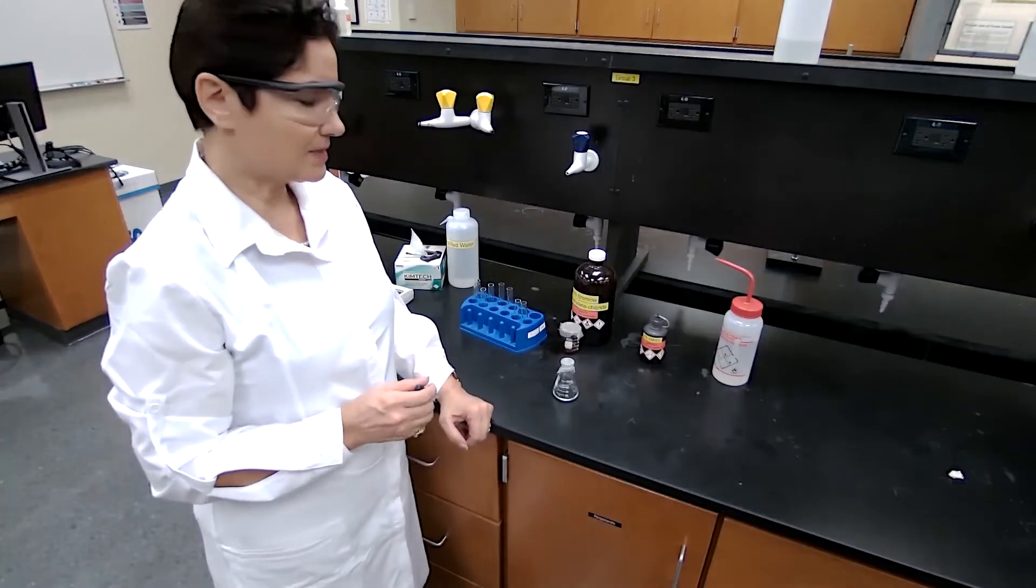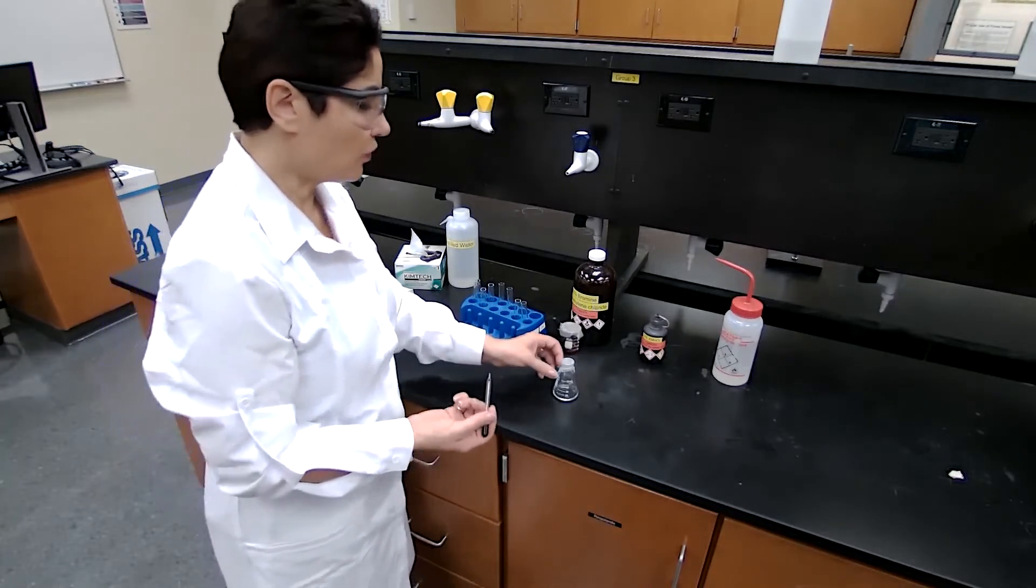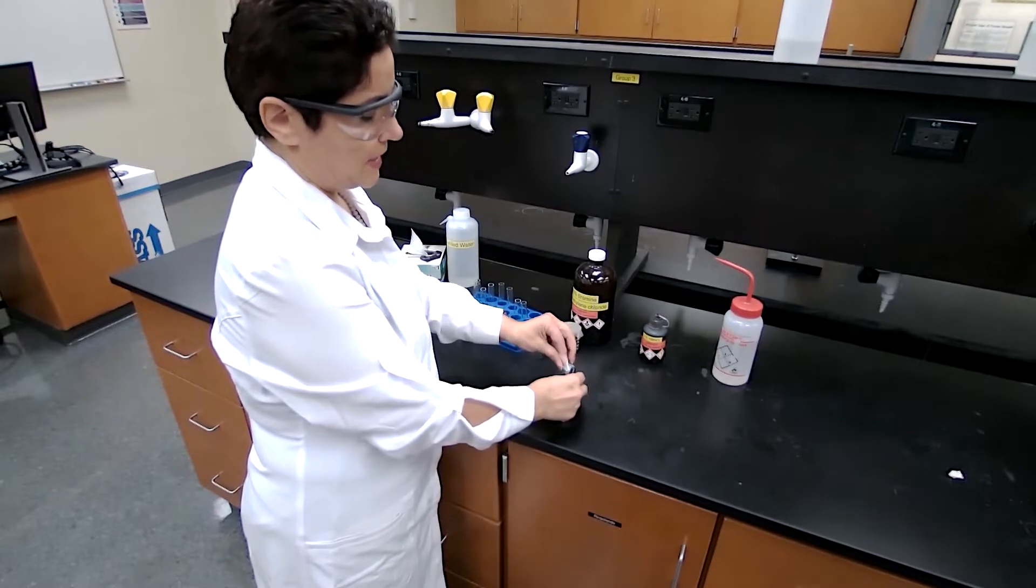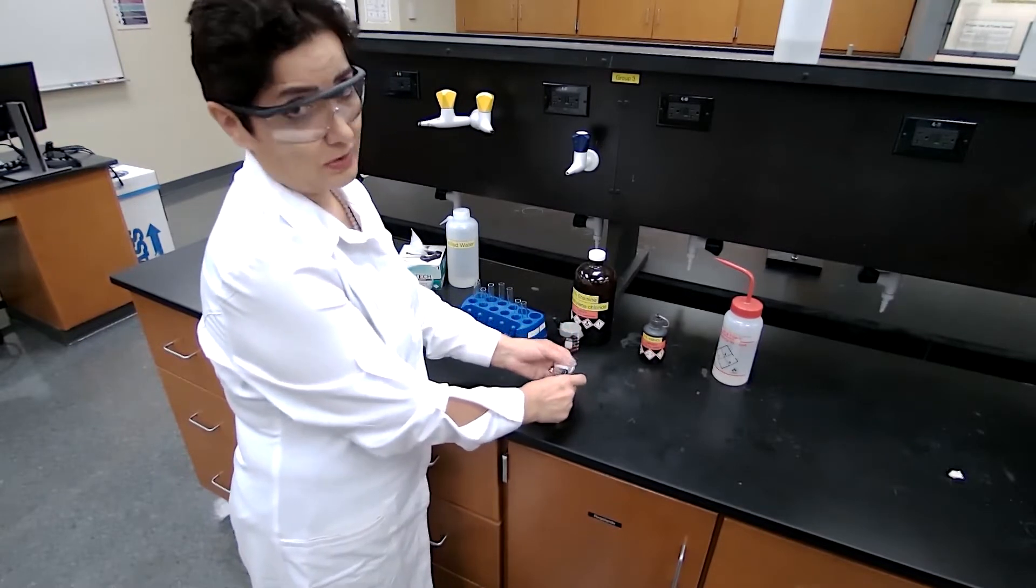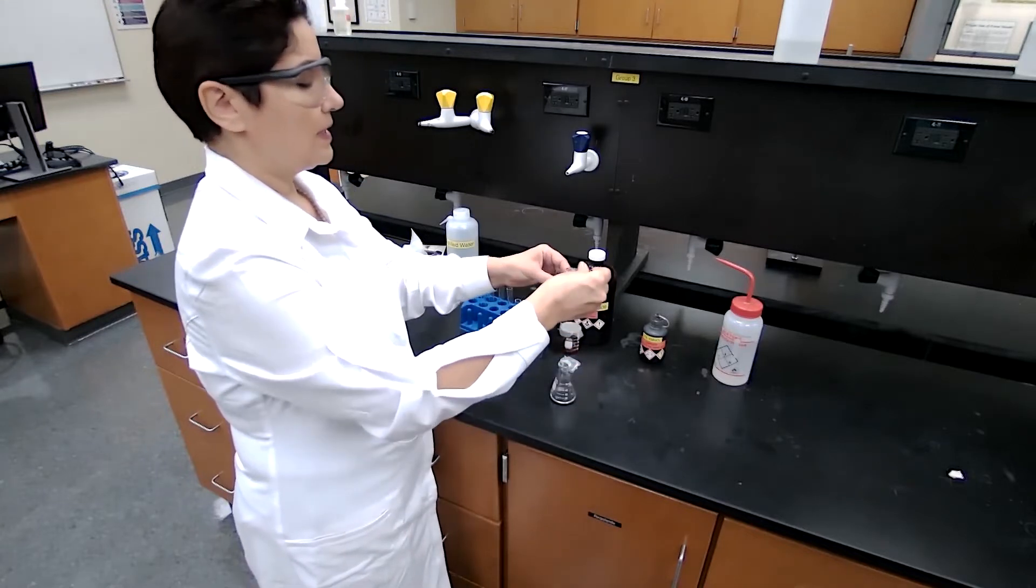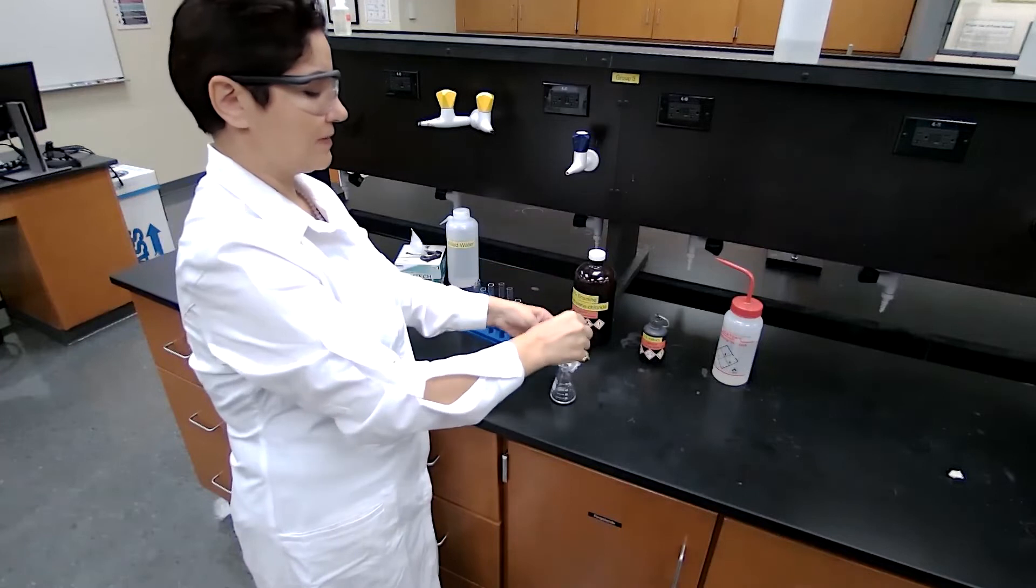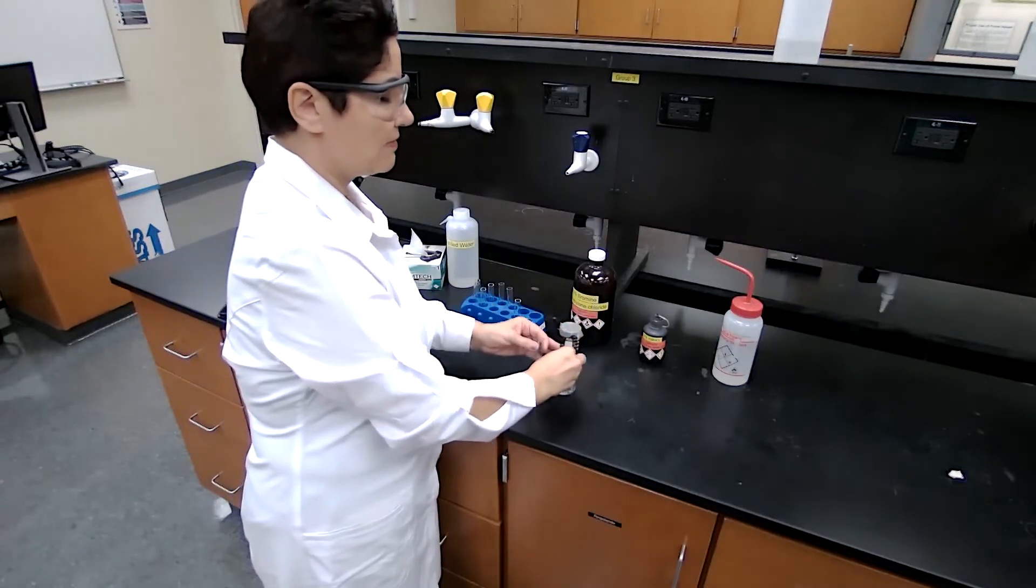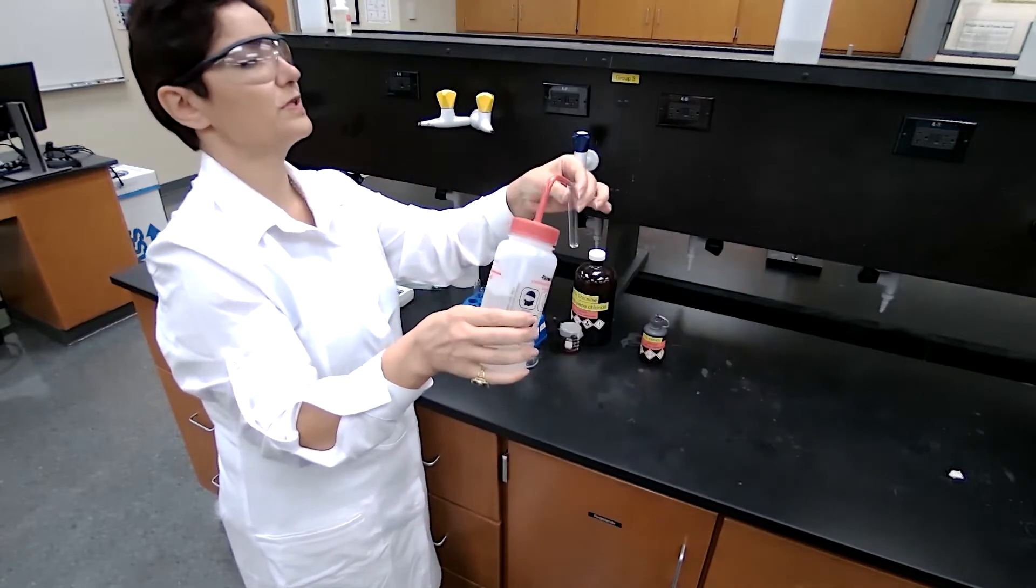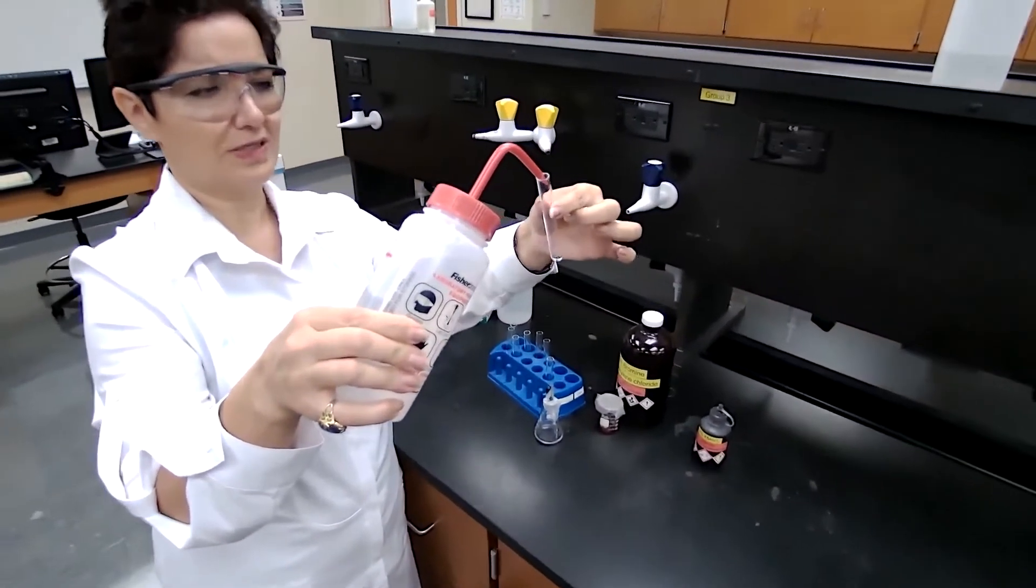For the chemical test, which is basically testing for the C=C double bond to make sure that it has formed, we have two tests. One is bromine with methylene chloride, which is called test for unsaturation. We take five drops of the sample and dissolve that in 20 drops of the solvent.